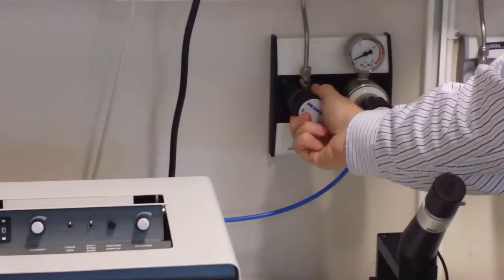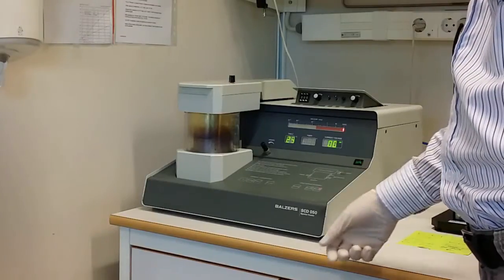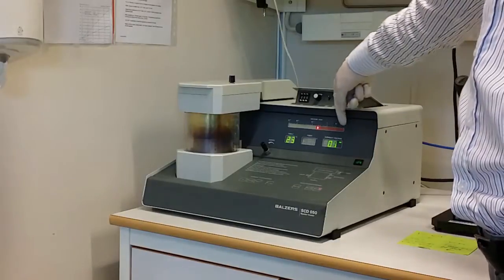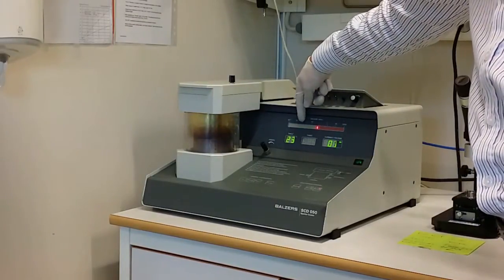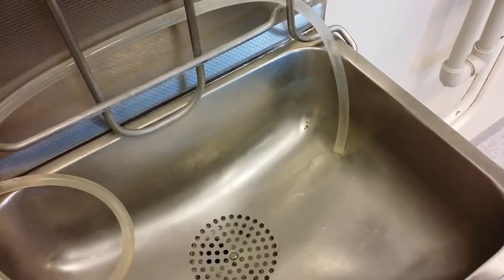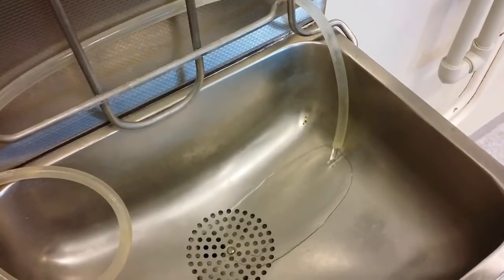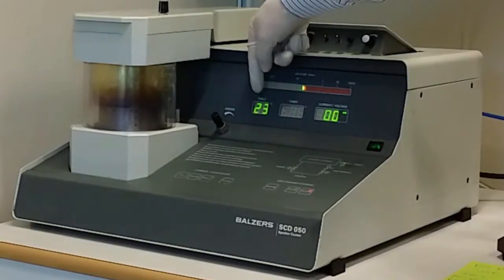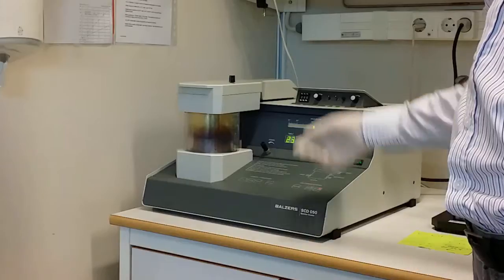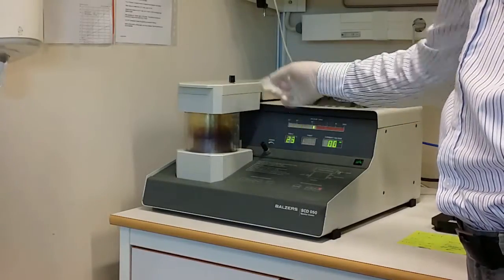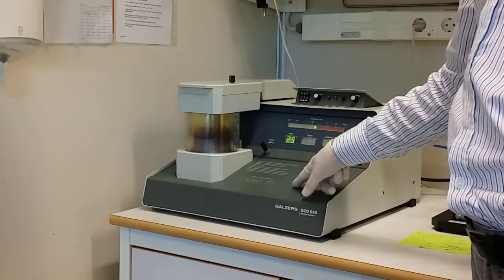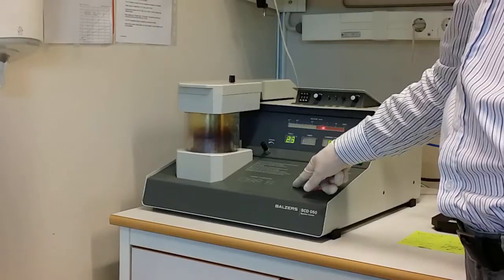So we start by turning on the gas here. That's the argon gas. Turn on the machine. And then we start to pump the chamber. Here you can see the pressure inside the chamber. And we want to come down to this range. That's sort of below 10 to the minus 1 millibar. You can also see that because we are cooling the system here with the cooling water, the temperature now has dropped to 23 degrees. That is okay. The next step now is to flush the chamber with argon gas. We do that by pressing this rinsing button. You can see it lets argon in because pressure goes up. And we do that several times.